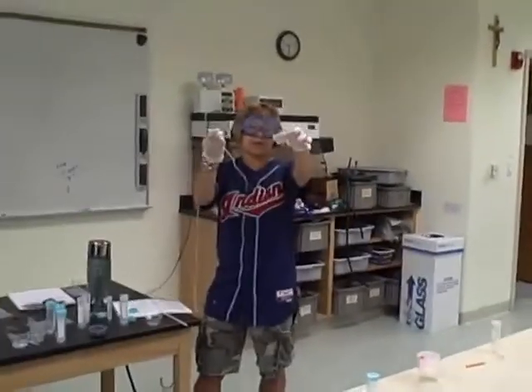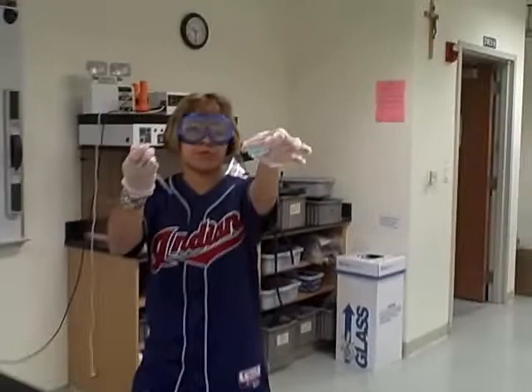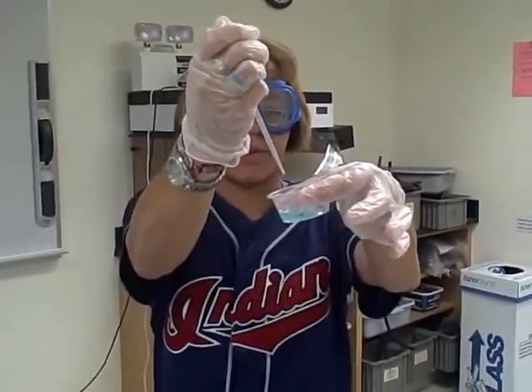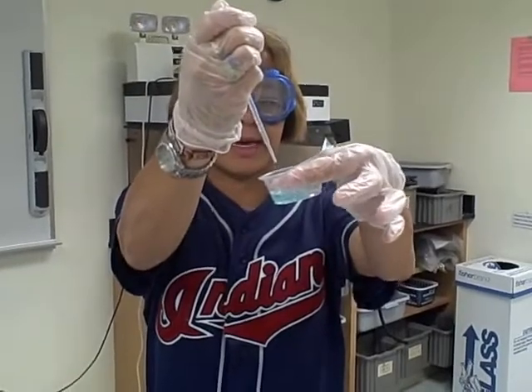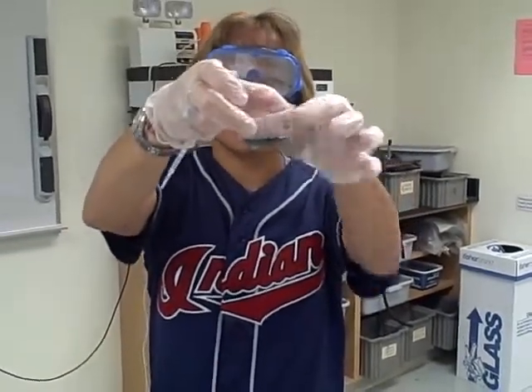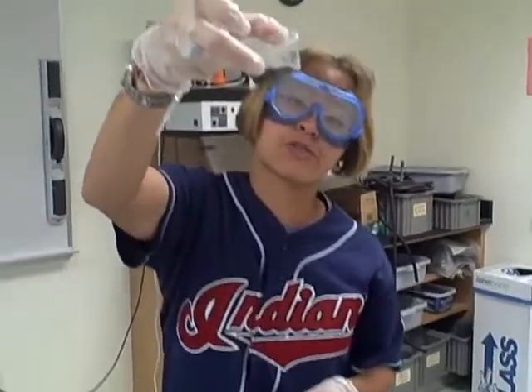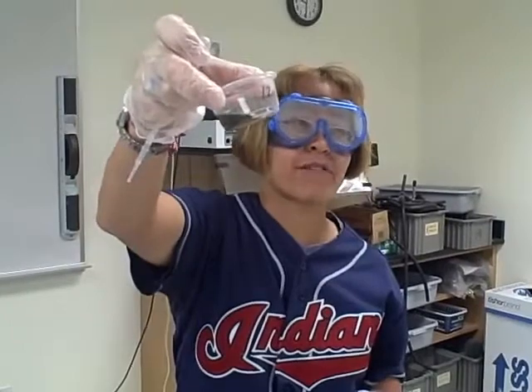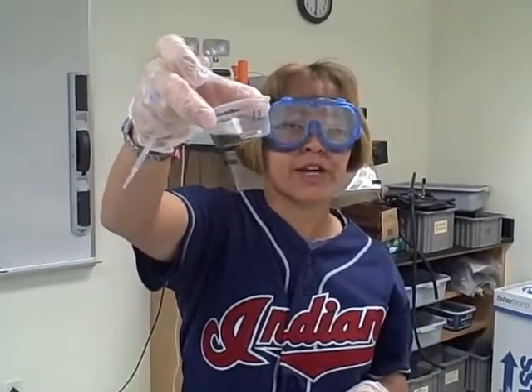This is a light blue, which is copper 2. And then when we add a drop, it should lighten a little bit. It will tend to go gray first, but you can sort of tell that there's a different, more yellowish color change.